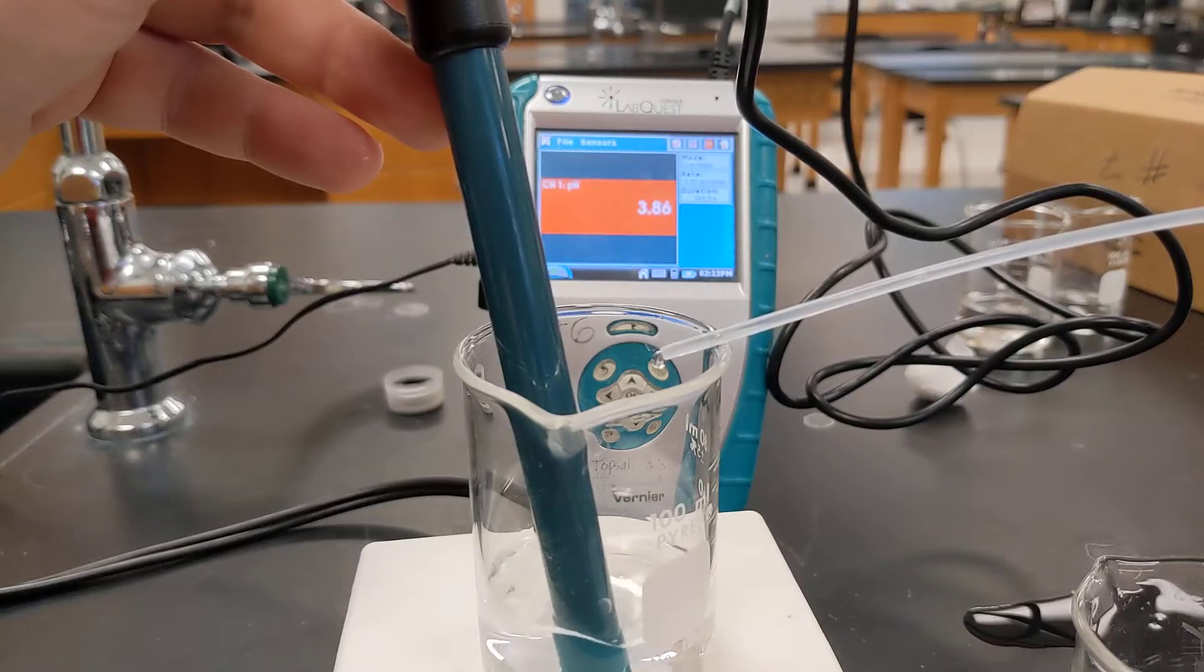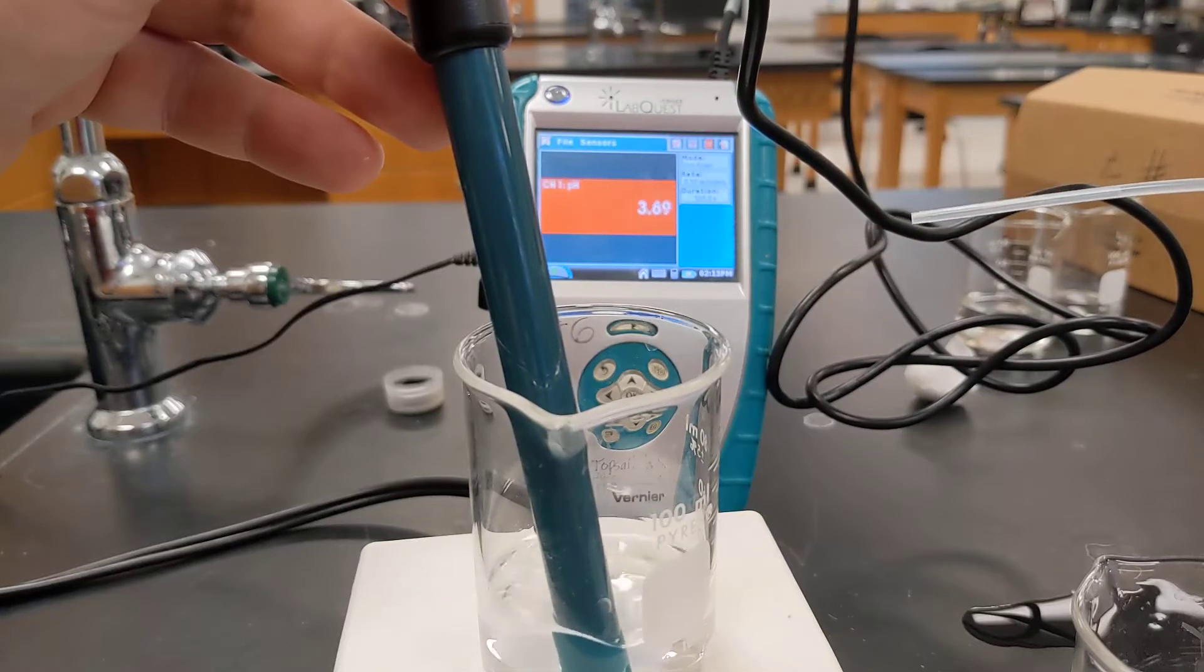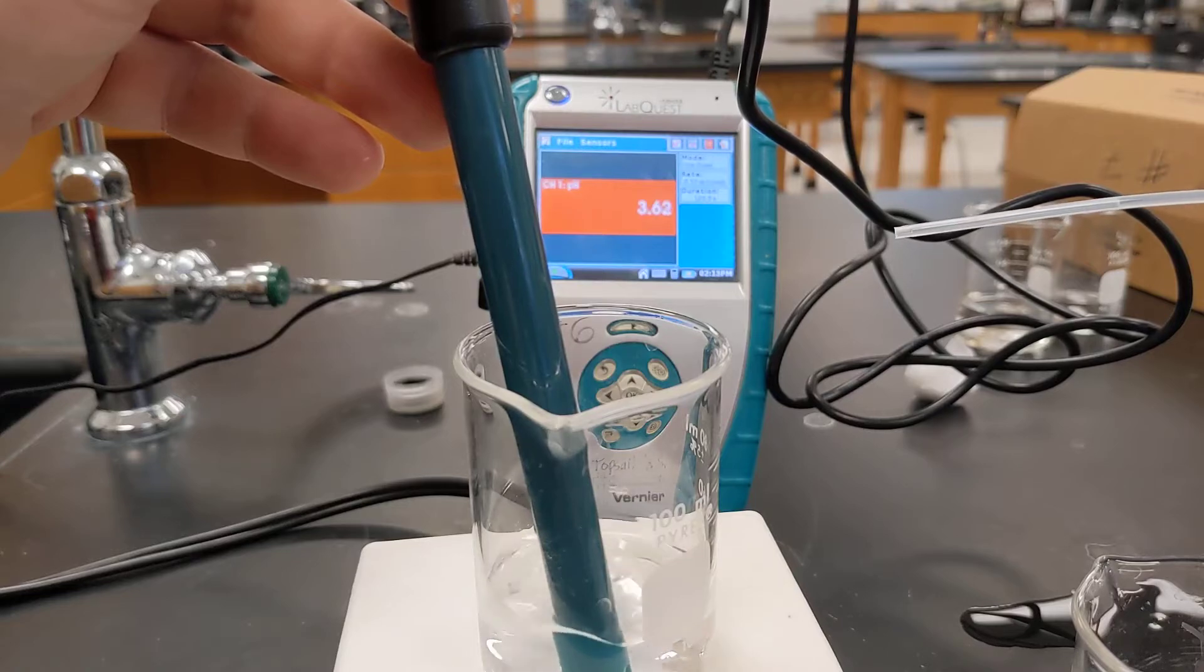If I add one more drop, you can see the pH just keeps on dropping.